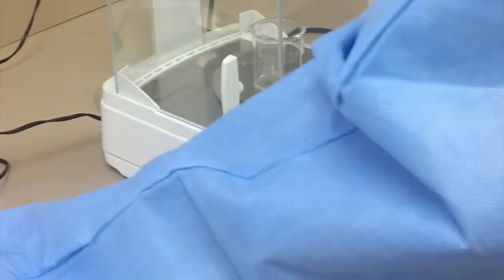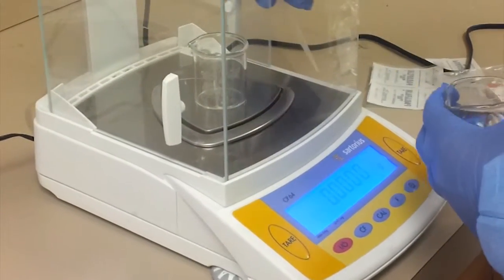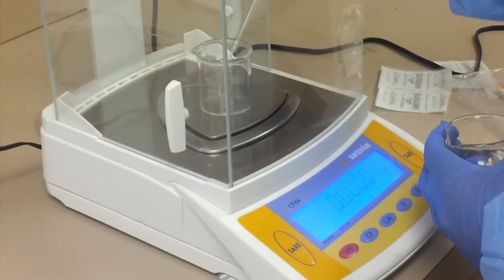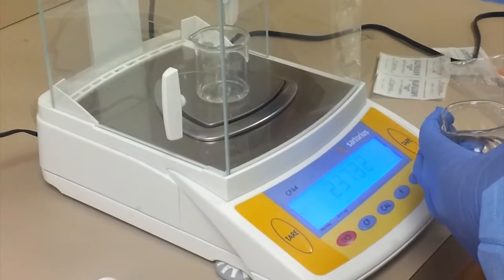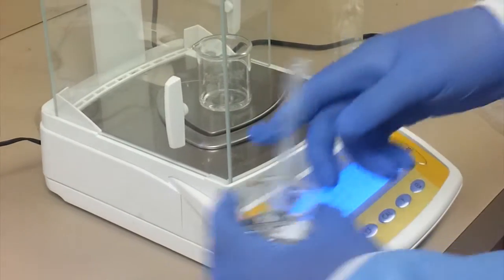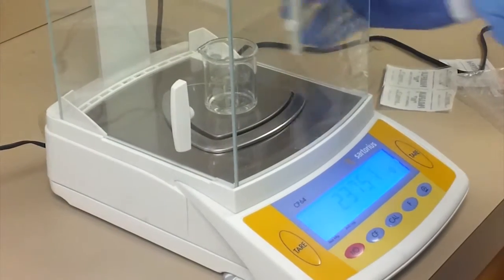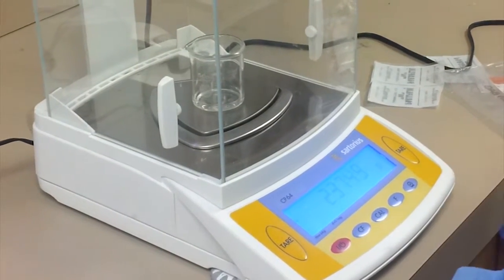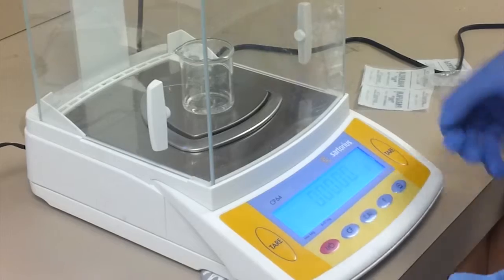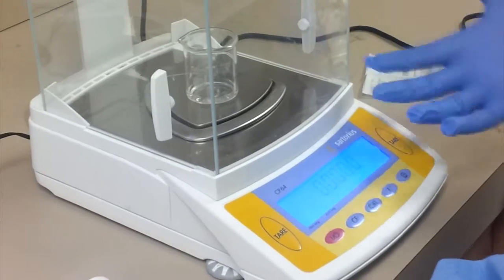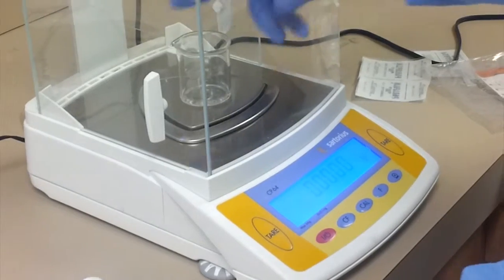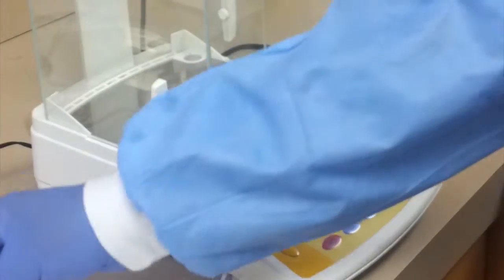This allows you to add more substance, such as this water that I'm going to add here. I'm just going to add about a squirt just to see how much the water by itself weighs. We see that it's at 2.3749 grams. And again, taring it just to add more substance or to reset the scale in general.